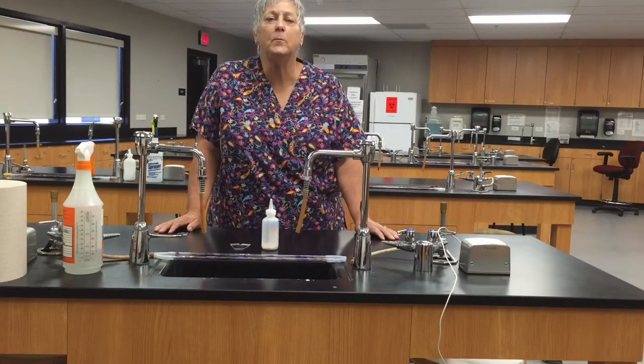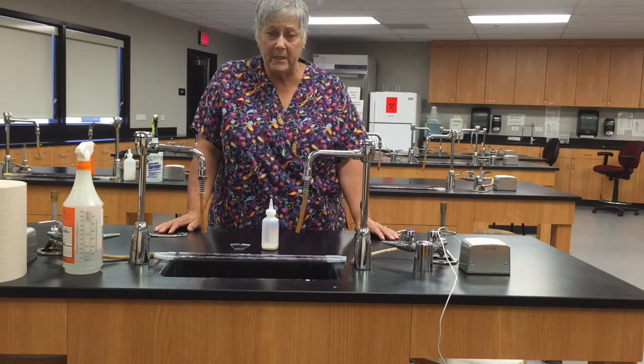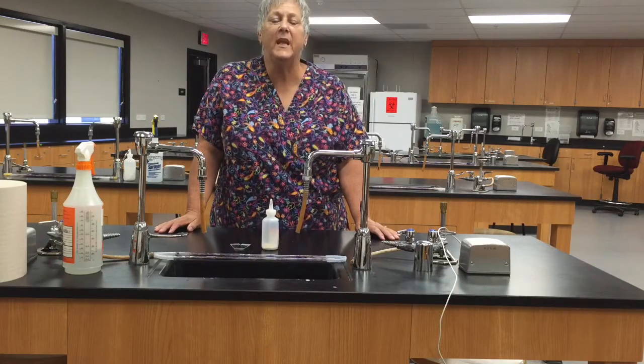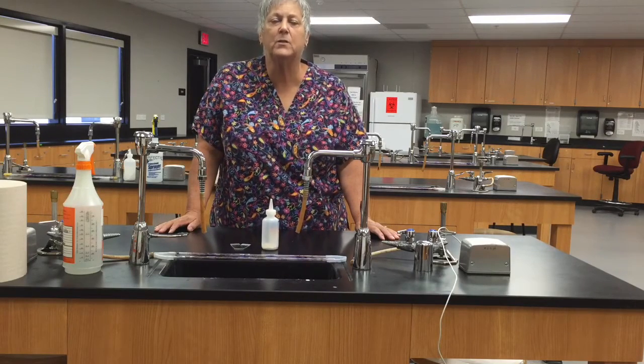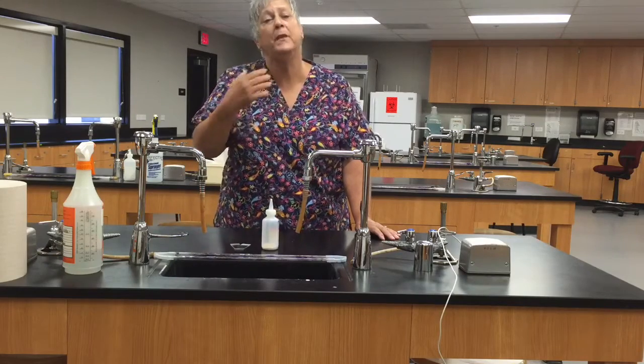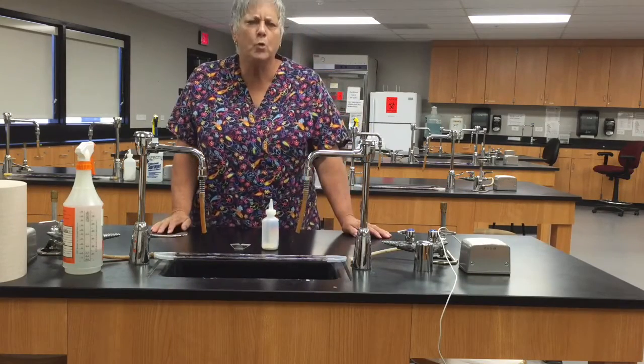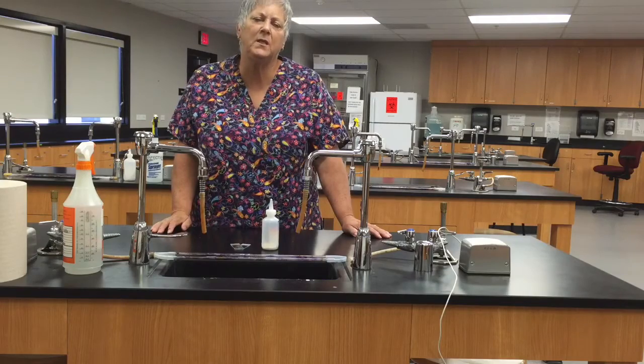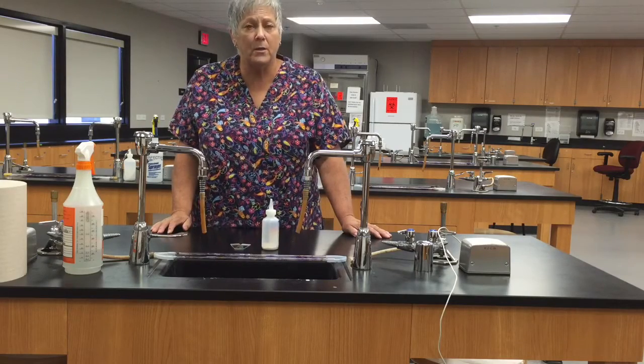Hi students, this is Professor Schimold and what I'd like to show you today is how to make an air-dried heat-fixed smear, which is the beginning step for most, not all, but most of the staining techniques that we're going to learn later on this semester.